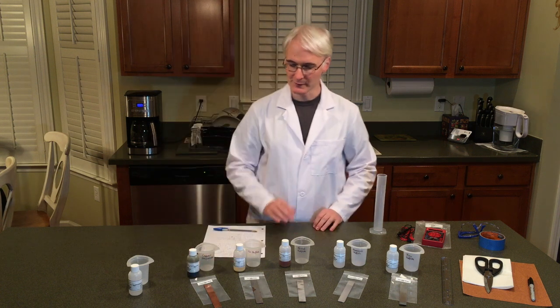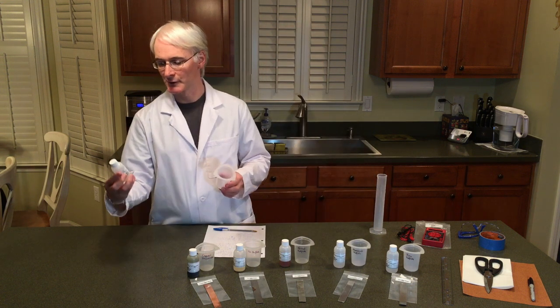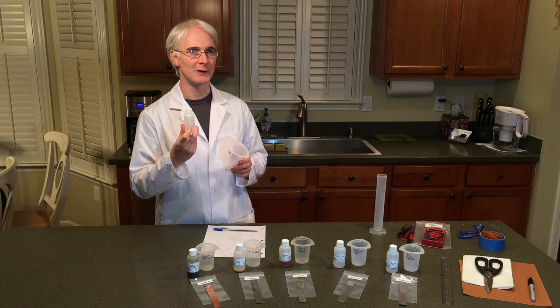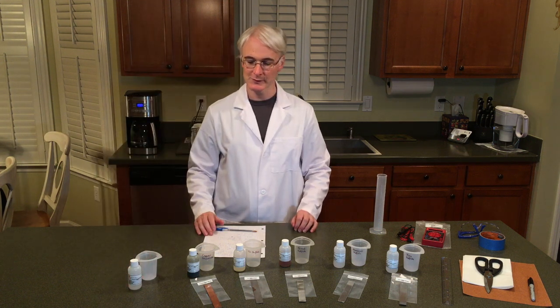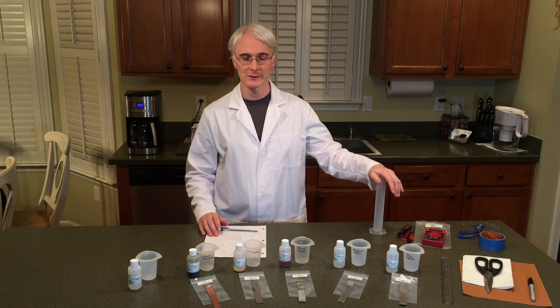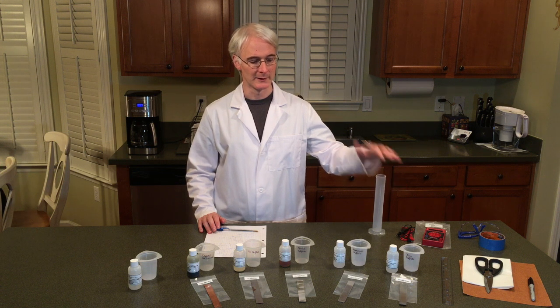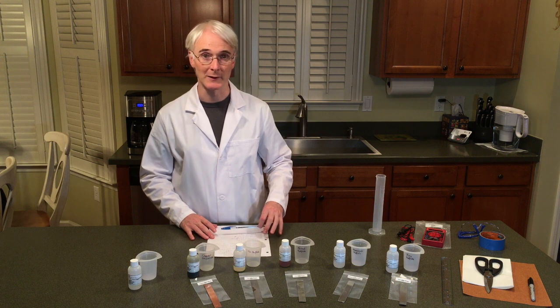Once you've got those names set up, you're going to need another beaker — this one is going to be potassium chloride. You should have about 25 milliliters for each of the liquids you're going to use. If not, you can eyeball it. The procedure says to use a graduated cylinder; if there's much variation in your kit, please do use it. I'm just going to use what's in each of the provided containers since I know it's in or around 25 milliliters.